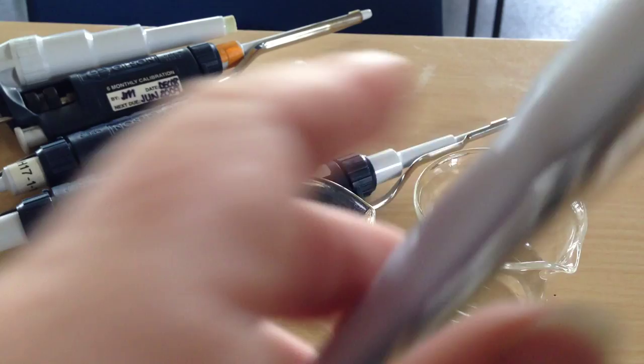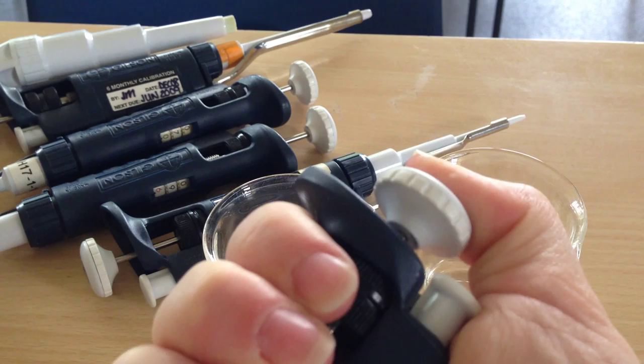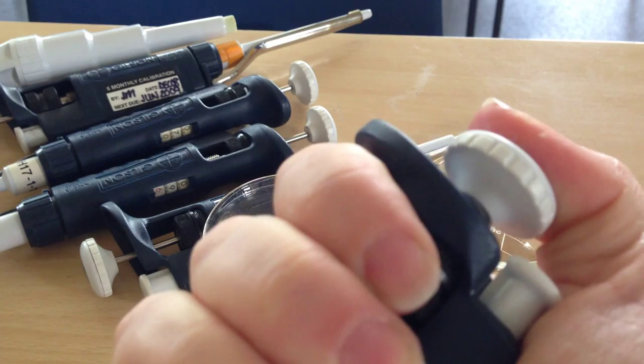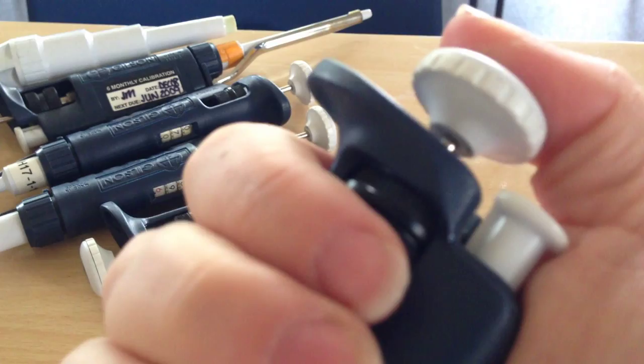And the really important thing about this is your positioning of the Gilson. So to suck material up into a Gilson, you'll find there's actually a two stop mechanism on here. This first action is quite easy. And then when you get to the stop, it's much harder to push it down the second. Once you play with Gilson it is quite noticeable to see the two stops.